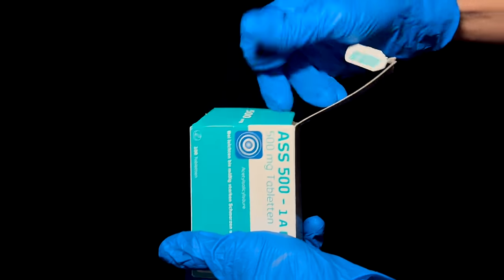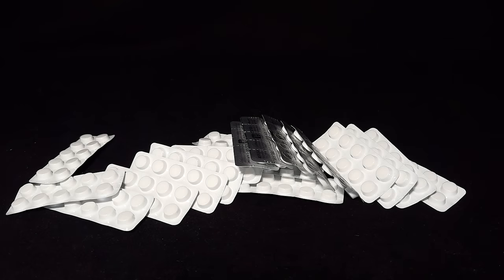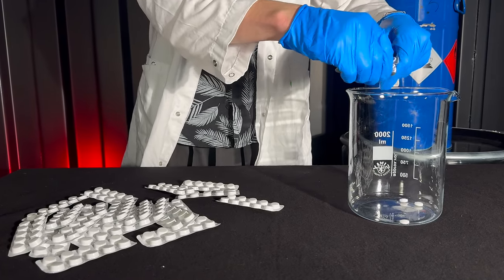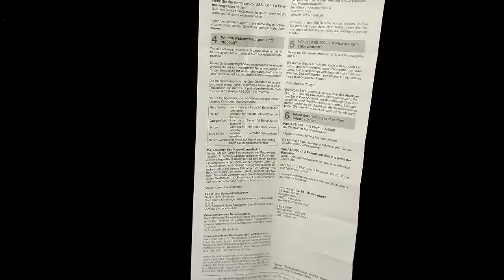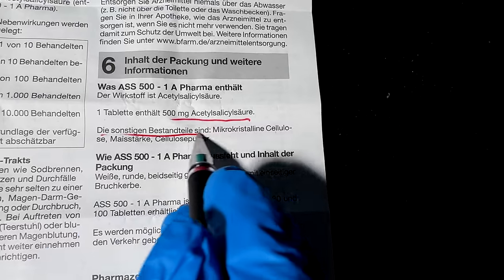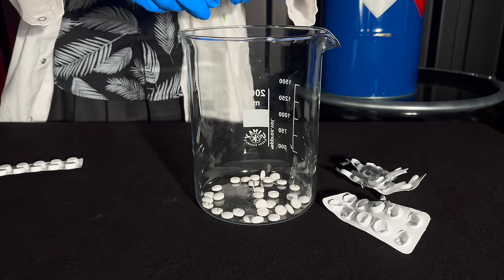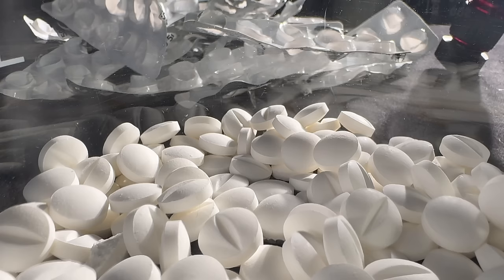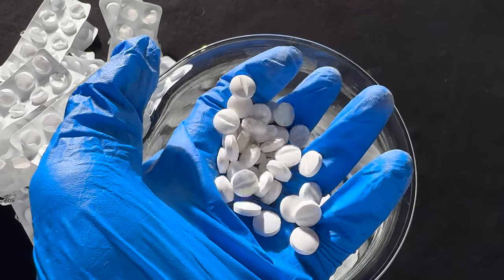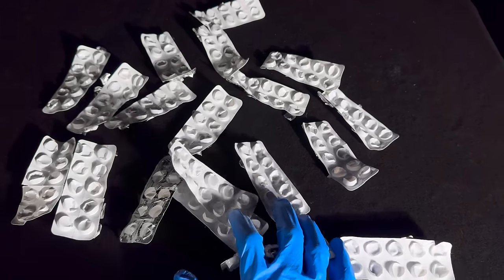I ended up acquiring 200 tablets containing 500mg of acetylsalicylic acid each. This means I have a total of 100g of aspirin to work with. Unfortunately, tablets are never made from pure active ingredient. They contain something called filler, which in this case is a mix of microcrystalline cellulose and starch. To get rid of them I am going to do a solvent extraction. Acetone seems to be the ideal choice. It dissolves our target molecule well and I can easily get rid of leftover solvent.